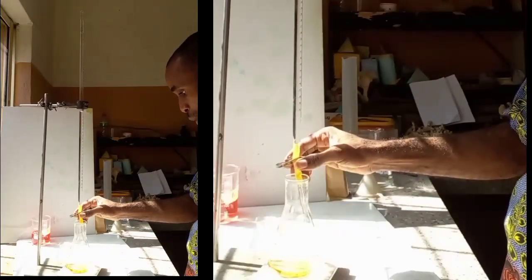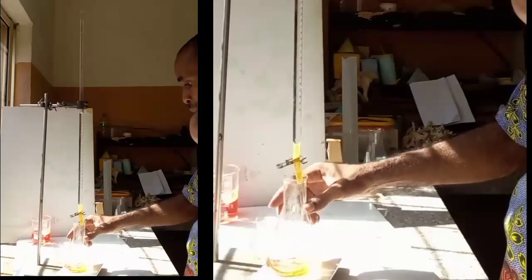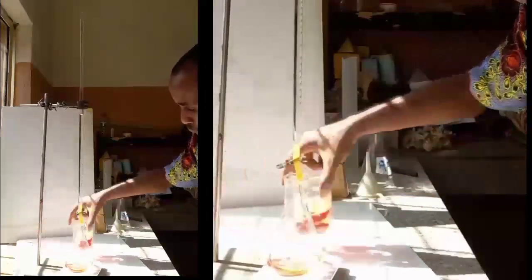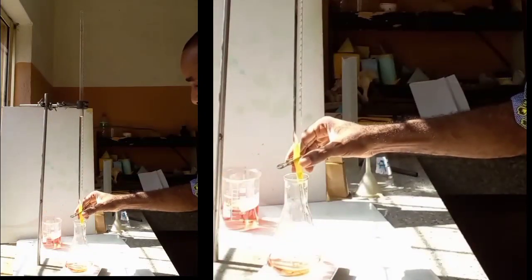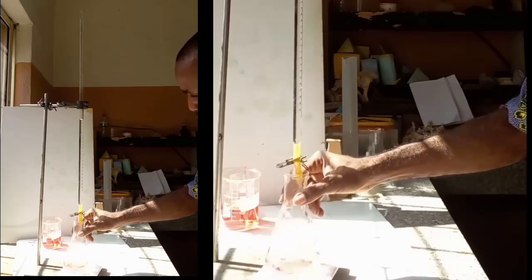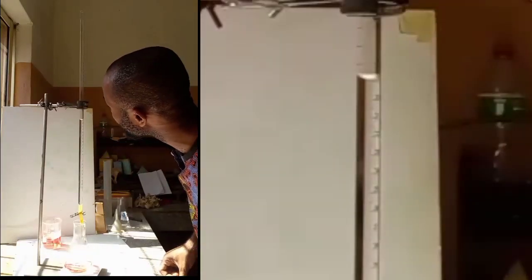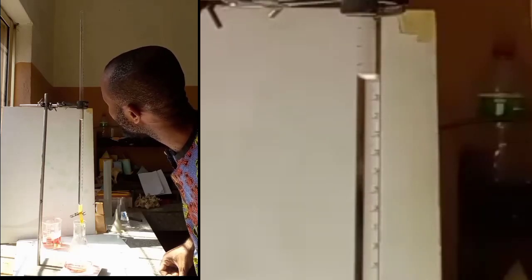But when you shake it, it goes off. From 27 — even from 26 — I am having a partial change. The change is not the final change. I am having it at 28.7. Therefore, I can make use of this. I can calculate from this. But we are supposed to know that the value lies between 27 and 29, and the values I am having here are more consistent. Therefore, from here, we can see our endpoint as being calculated and shown on the screen.